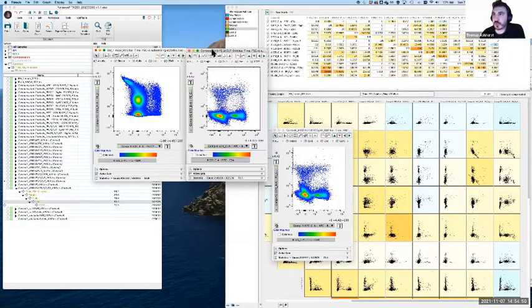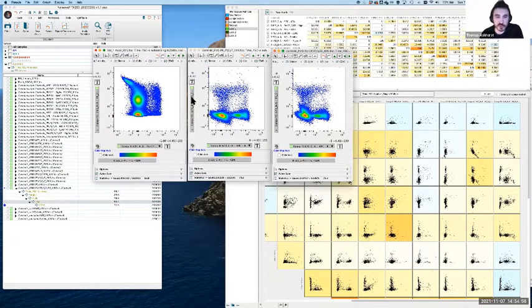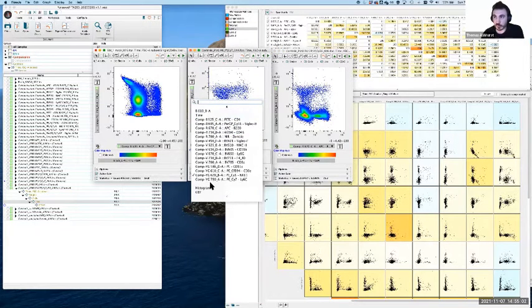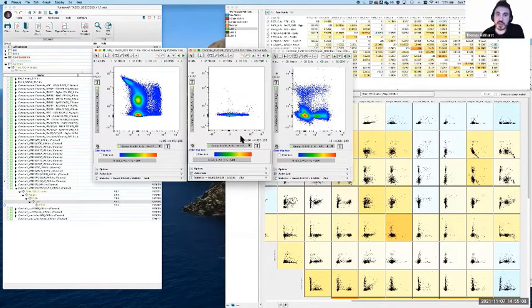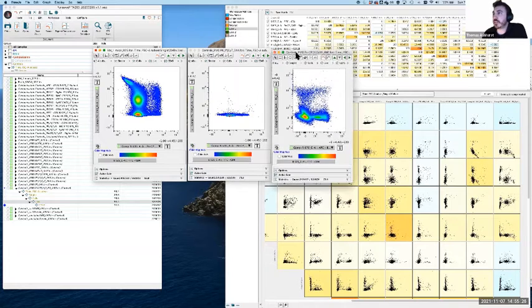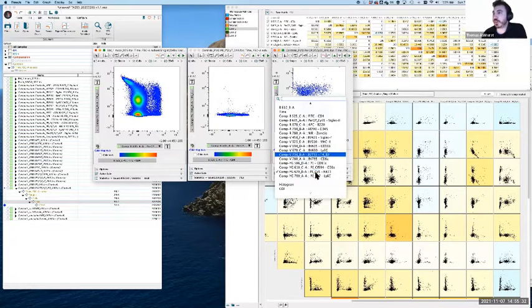Now, the FMO controls, in case anyone is not familiar with the term and is wondering what the heck I'm talking about: an FMO control is essentially the same as the fully stained sample, but one fluorophore has been removed. So the idea is that if you have a full set of FMO controls, you have as many FMOs as you have colors, minus one. For example, this FMO is the same sample with all of the antibodies included except for PE-Cy7, so there is no PE-Cy7 signal in this sample. And this one is for PerCP-Cy5.5. It's the exact same deal, but every color is there except for PerCP-Cy5.5.